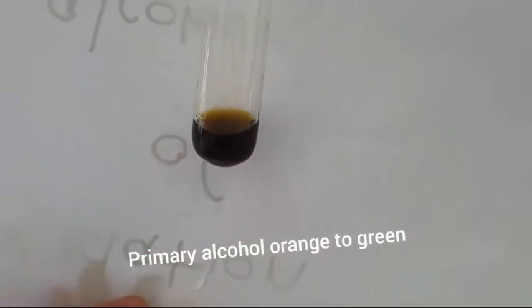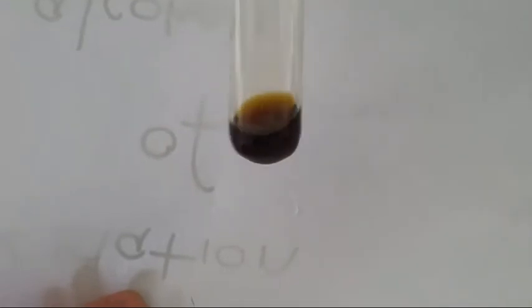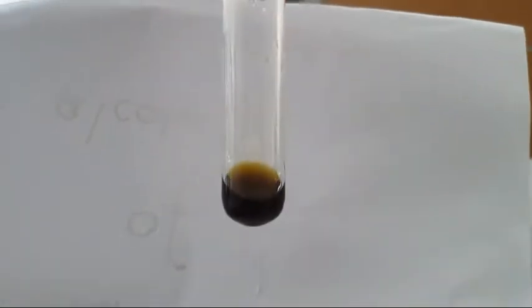In test tube 1, the solution has changed colour. It's gone from orange to a green. It's a very deep green, so it almost looks black when it's together, in test tube 1.